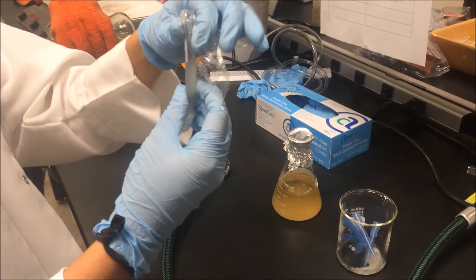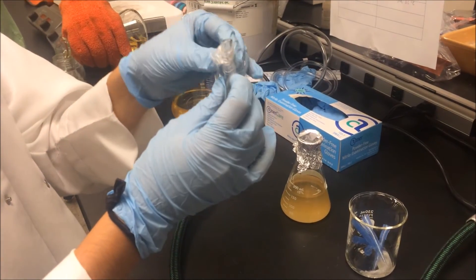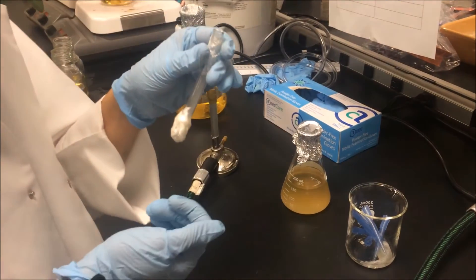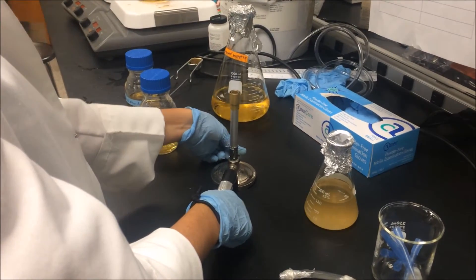Cover top with plastic wrap. Turn the Bunsen burner off.